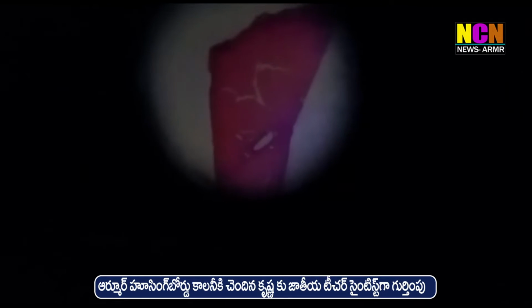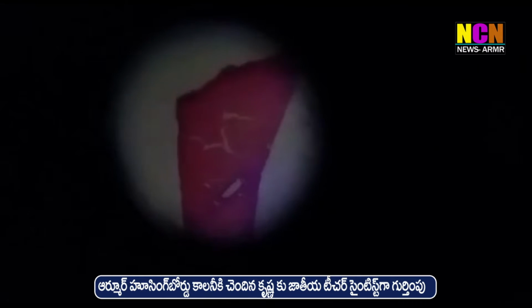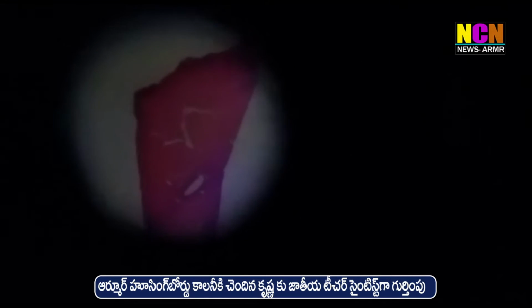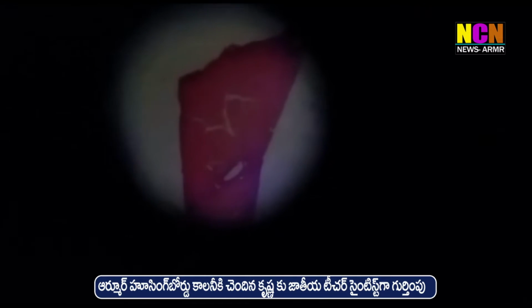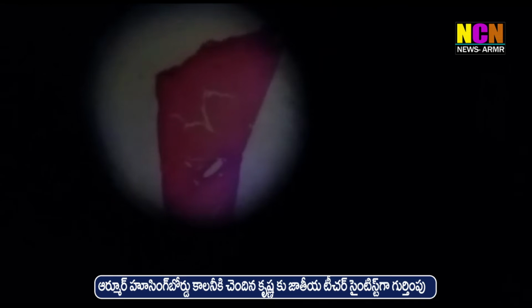This is how we can place it so it is easily visible to every child in our classroom. Then we can make every child understand the properties of the cell, the specimen which we have taken. So this is a microscope projector using a torchlight. We will try another one.